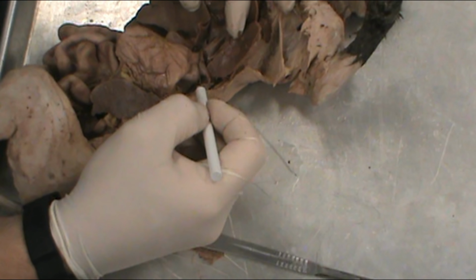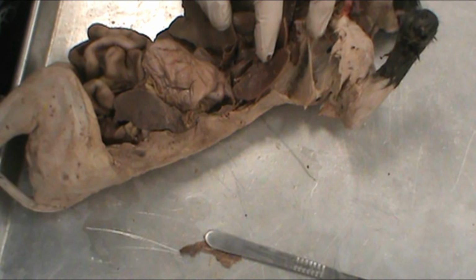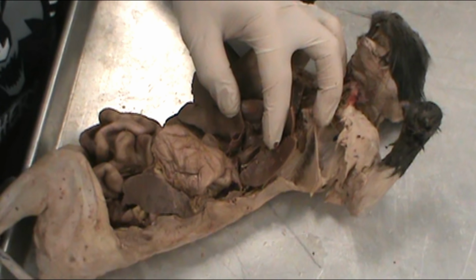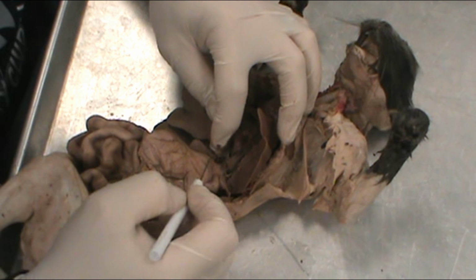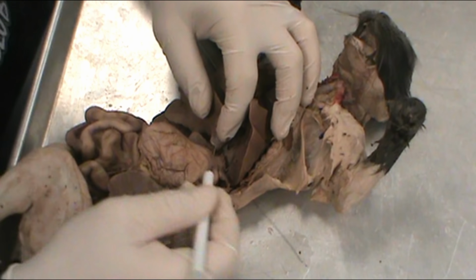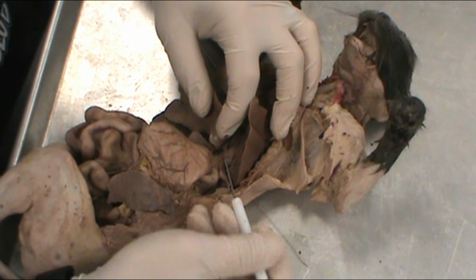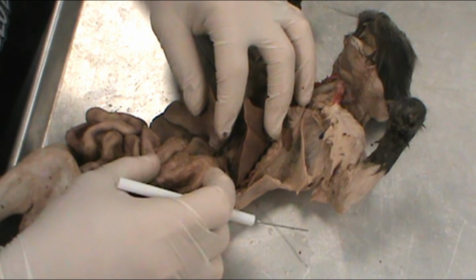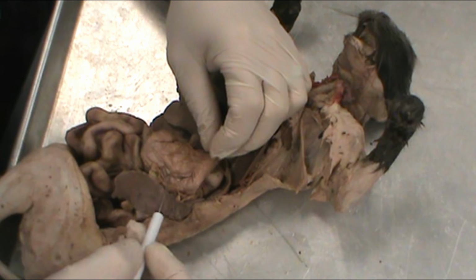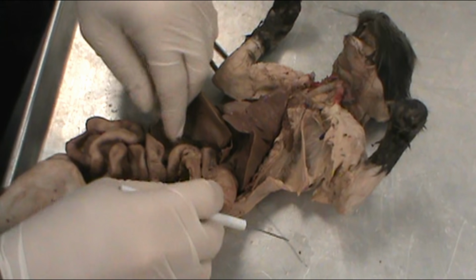At the bottom of the esophagus, tip that camera a little bit more here. Wrong way. There we go. At the bottom of the esophagus, closing off the stomach, would be the cardiac sphincter. So that keeps stomach juices and food contents from going back up into the esophagus, causing acid reflux. So again, we have the stomach. The tiny folds inside of the stomach are known as the rugae. They increase the stomach surface area, aiding in chemical breakdown of the food.